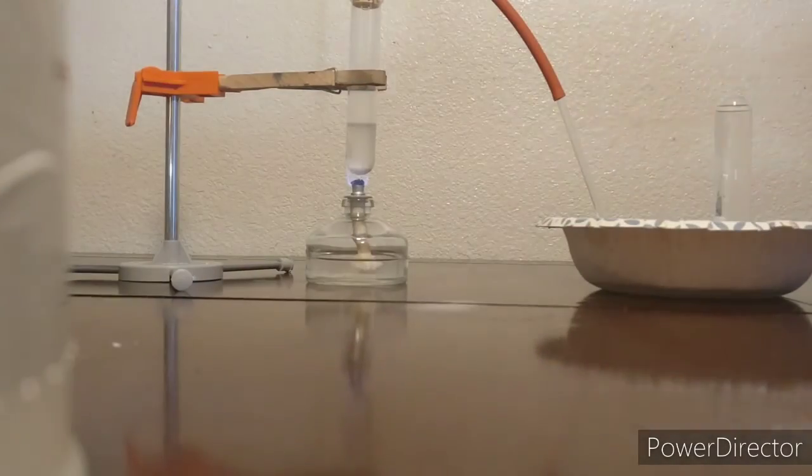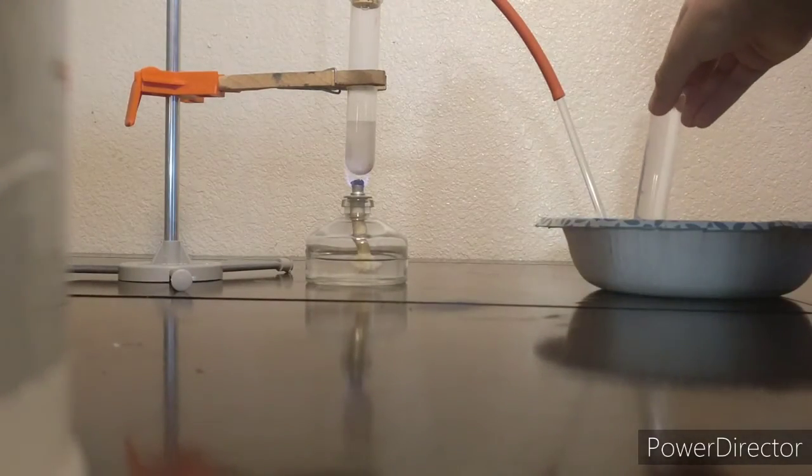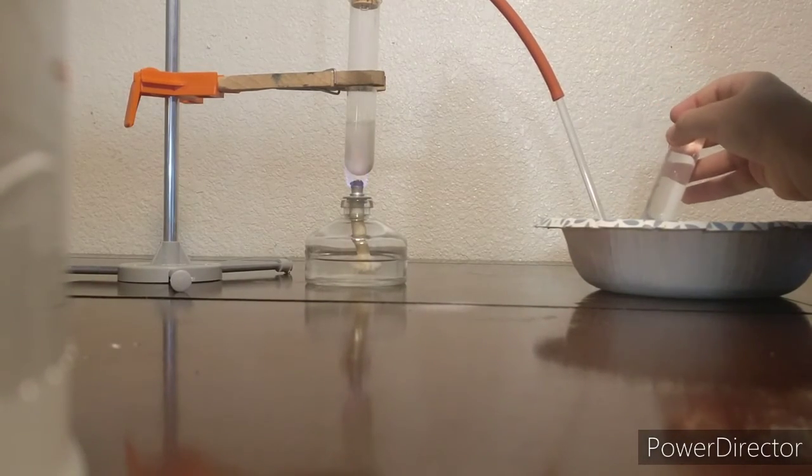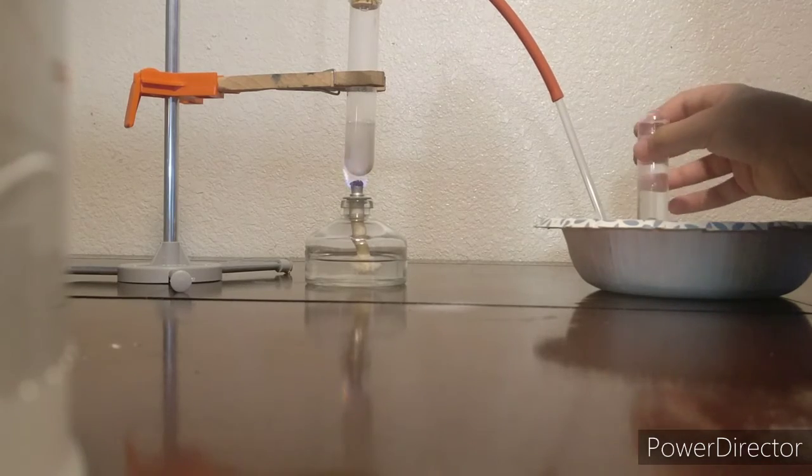Unlike the previous reaction, this produces tons more oxygen, and I could have filled the second test tube. That would have been better because usually the first test tube is just air. Then, when I finished, I dropped it and then quickly refilled it.